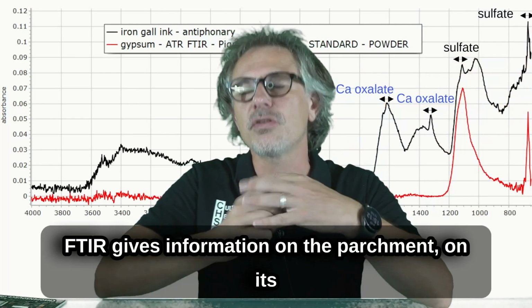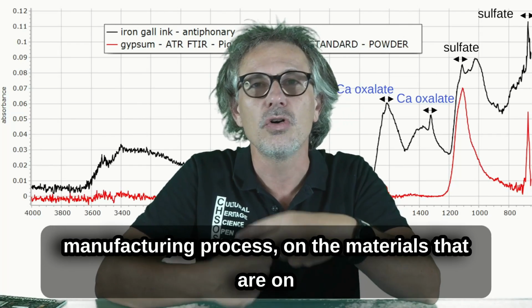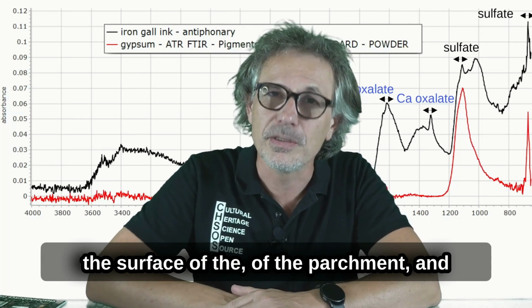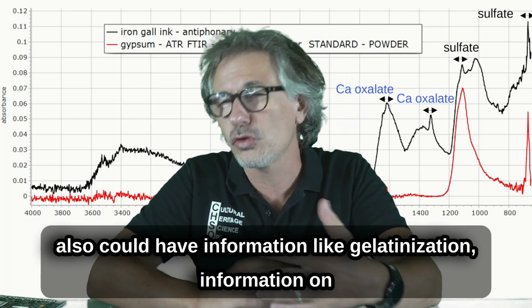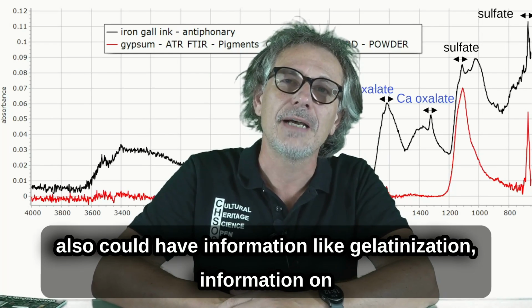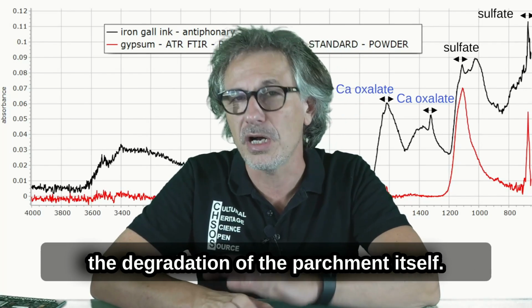FTIR gives information on the parchment, on its manufacturing process, on materials that are on the surface of the parchment, and also could give information like gelatinization, and information on the degradation of the parchment itself.